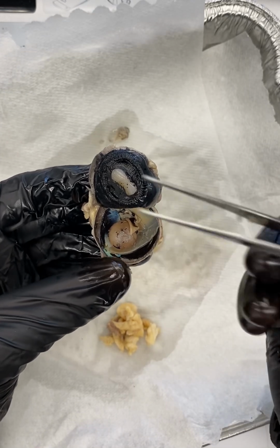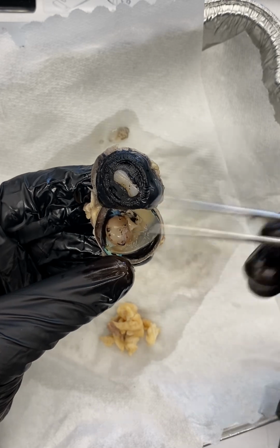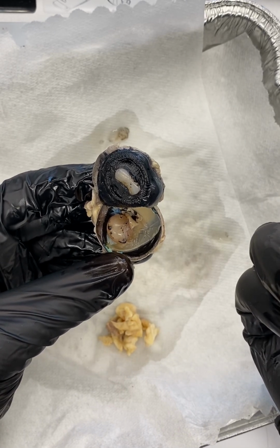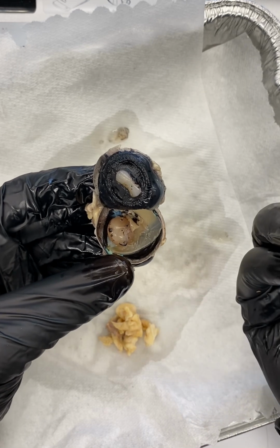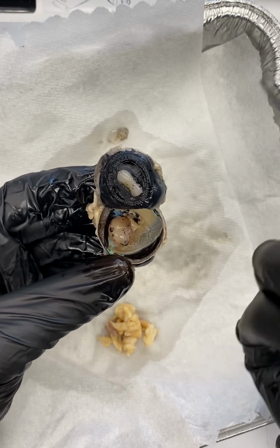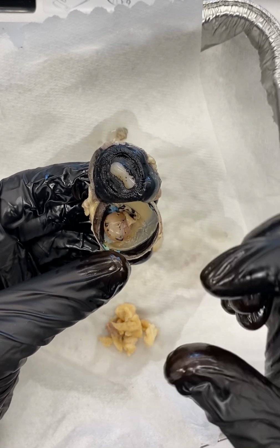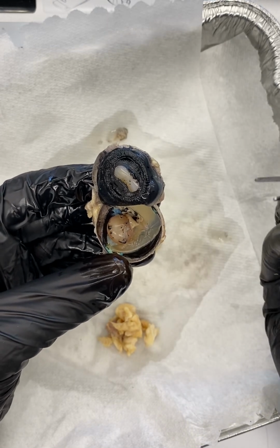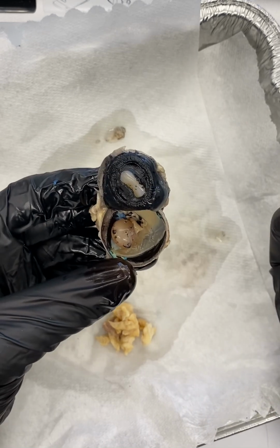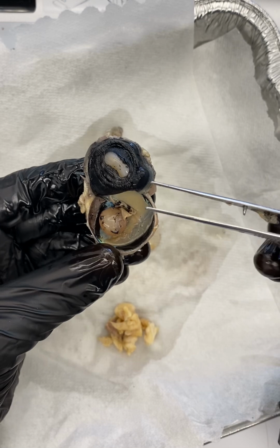And so you can have errors with this, or you can have problems with this as you age, as the lens becomes less flexible, right? So maybe the lens is more permanently round, right? Because it's not as pliable, it's not as easily flexible, it stays round, and so you have difficulty seeing things at certain distances, right? And so these are changes that can occur as we age, right?